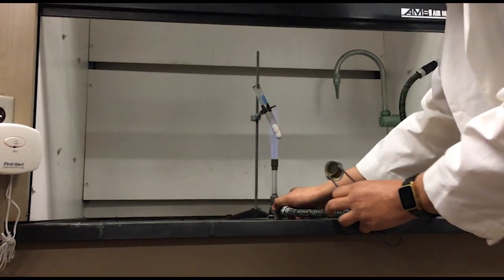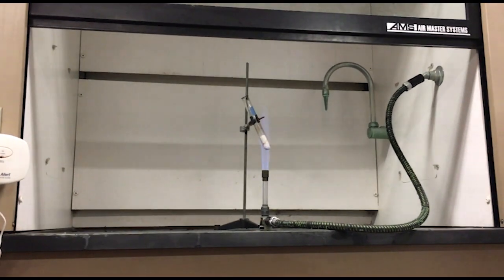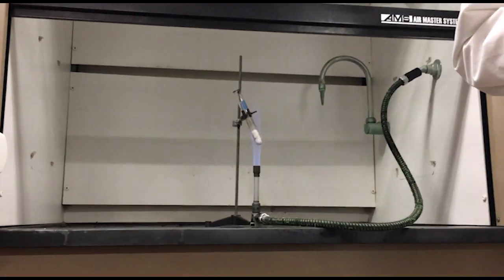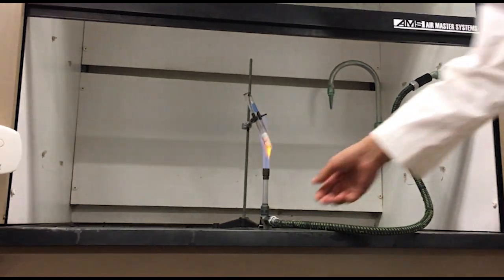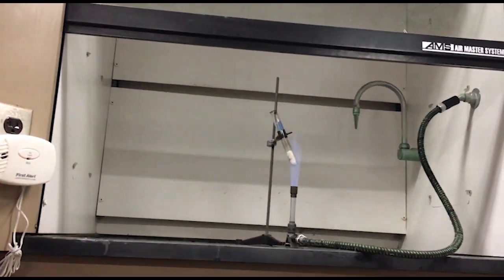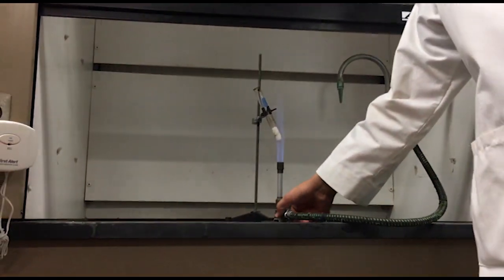How am I going to know when to start? I'll tell you. I'm going to slowly heat up the sodium chlorate. Now, you all know that when a metallic chlorate is decomposed, you're going to make a metallic chloride and oxygen gas. And so we are making some sodium chloride because this is sodium chlorate. Okay? You don't have to cover your ears. This is not going to be loud.